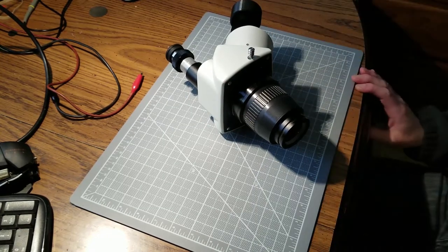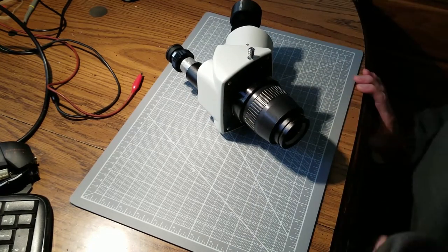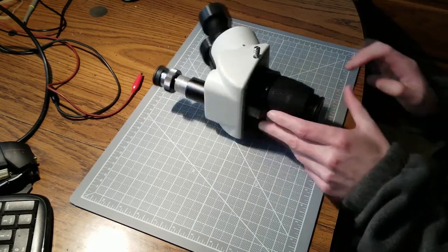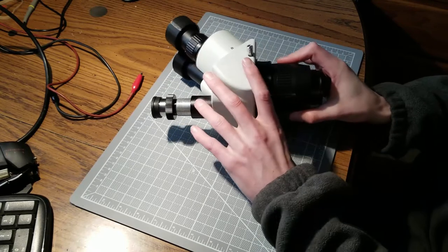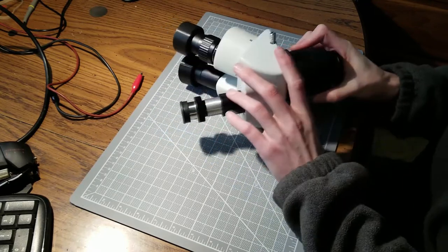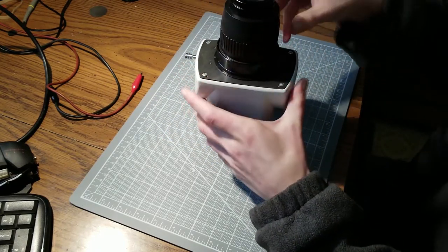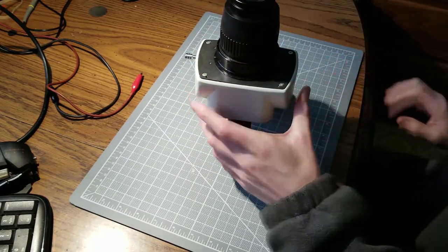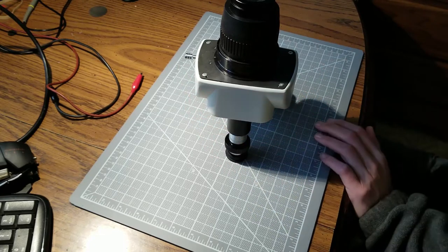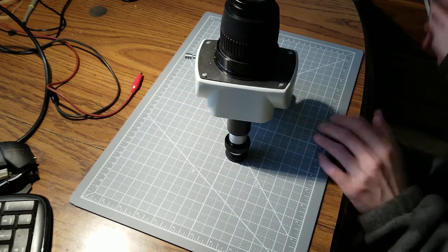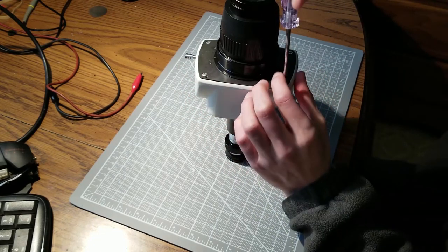I've wanted to take it apart because it looks as though there's a shutter on the side of the microscope that would open and close the path for trinocular viewing.